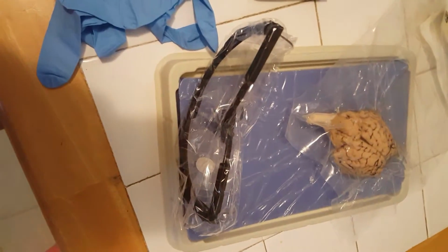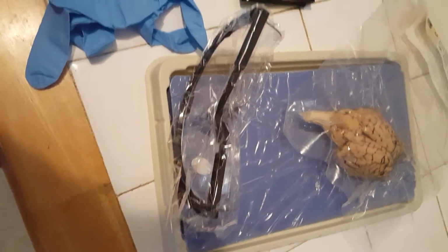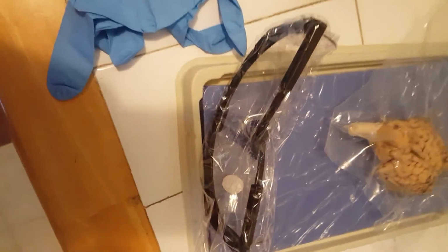I have all my materials right here. I have the face mask, the sheep brain, the dissection tray, the dissection toolkit, my gloves, and my safety glasses. Now I'm going to put them on. As you can see, I do have all my safety stuff on. Okay, I am now going to start. I have my paper right here with the words highlighted that I'm going to be naming. And I'm going to set my phone right here.